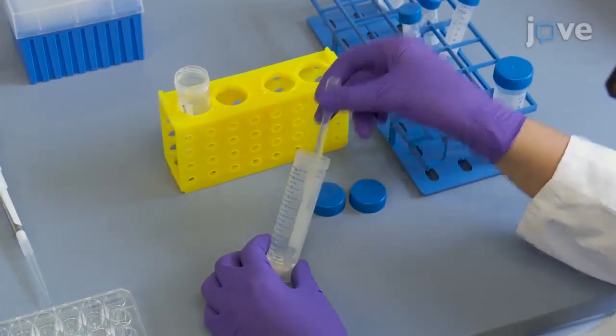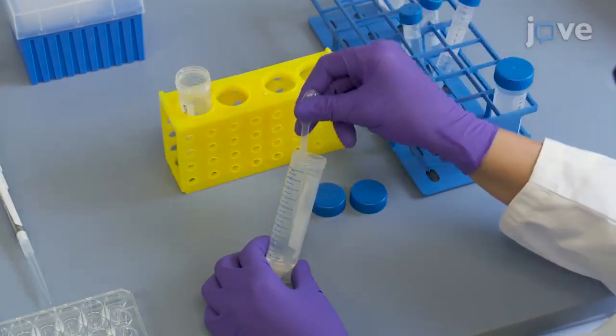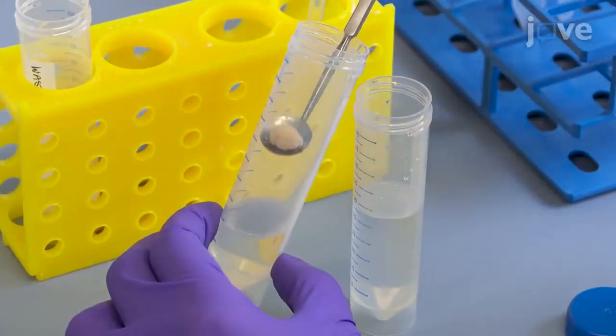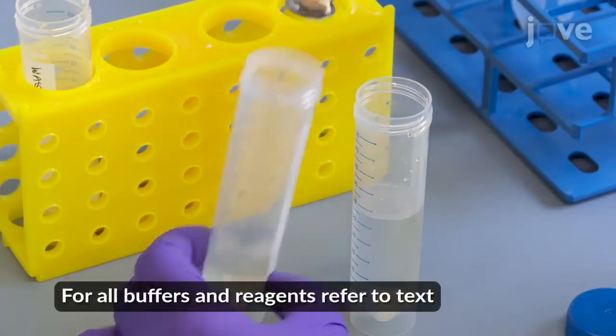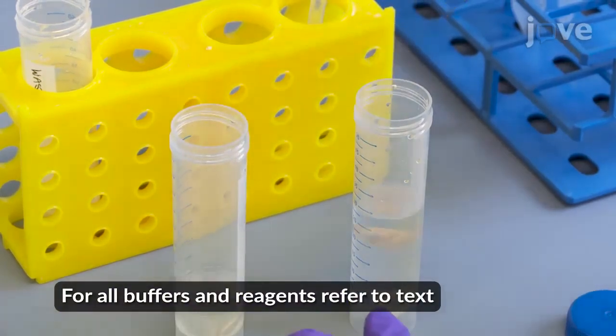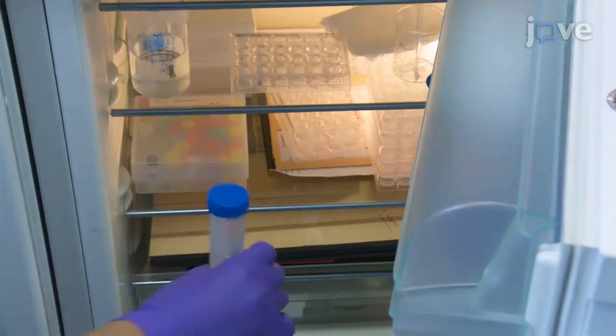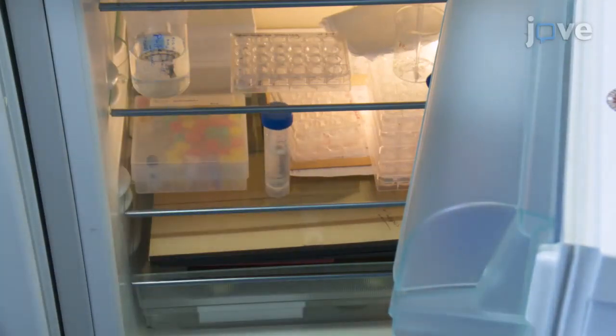Begin by washing previously isolated and fixed mouse brain as described in the manuscript. Then transfer the brain to a 50 milliliter reaction tube with 30% sucrose in 0.1 molar PB. To cryoprotect the brain, incubate it at 4 degrees Celsius for 48 hours or until it sinks.